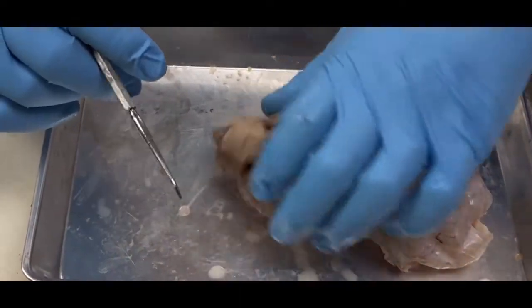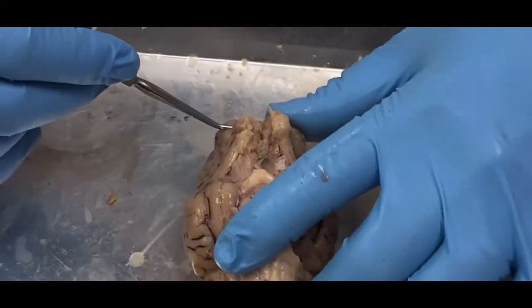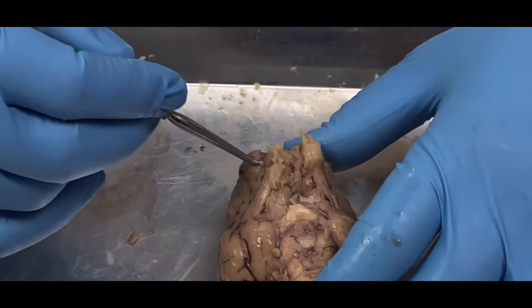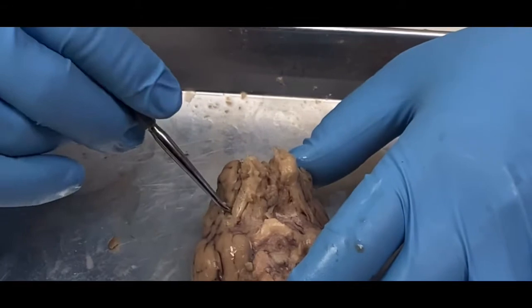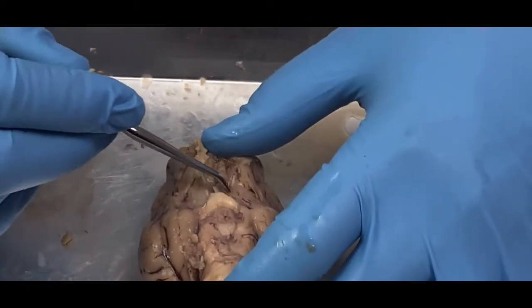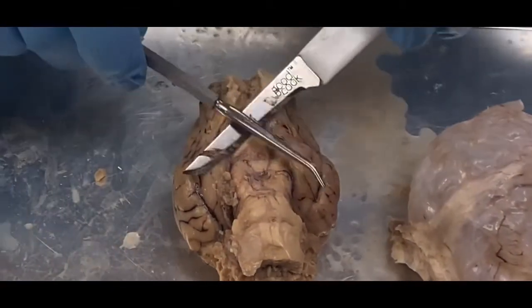So if we flip this over real quick, there's some structures we'll notice. And again, this is the front of the brain right here. We have the olfactory bulbs, which are right above our nose. Okay, and again, it's a sheep, but these would be right above our nose where the nerves come together, and those are the bulbs. And then you can see the olfactory tracts, which head down into the brain so that smell can be sensed. You'll notice right here, it's actually cut away, but this is where my optic chiasm would be, down in here. And this should actually cross over something like this. Okay, but you can see that's been cut away.